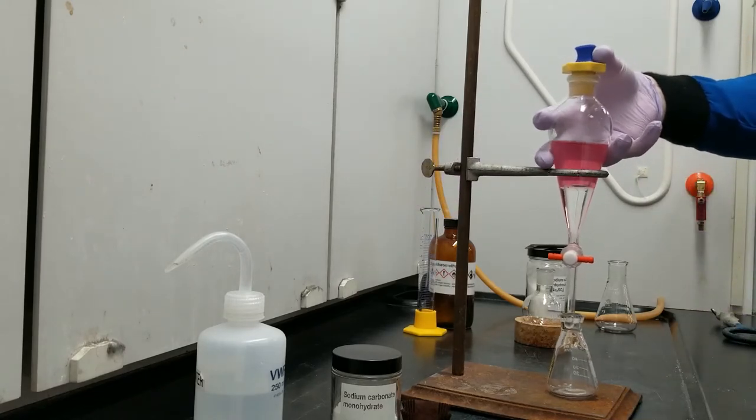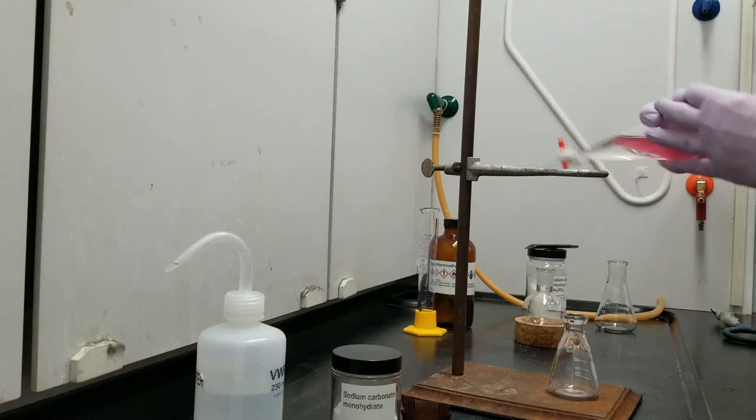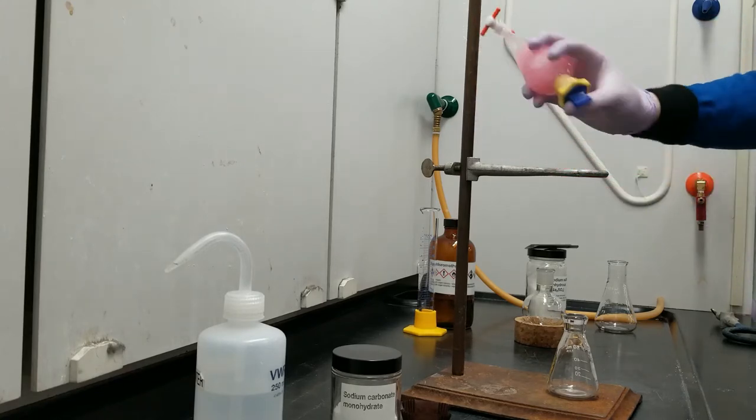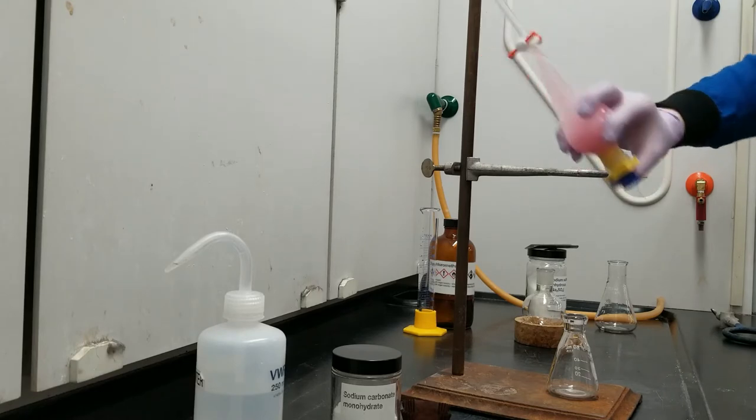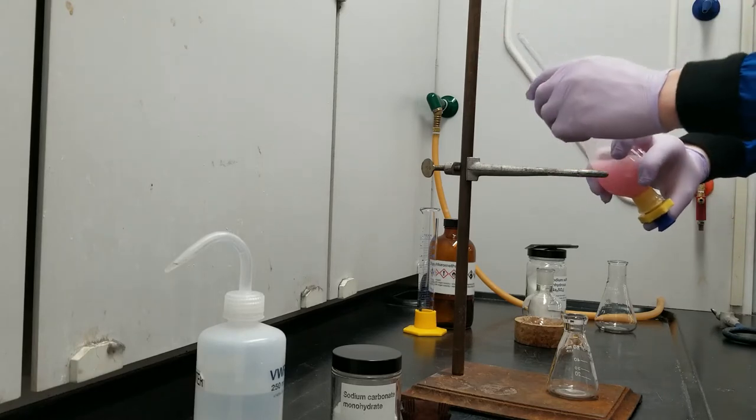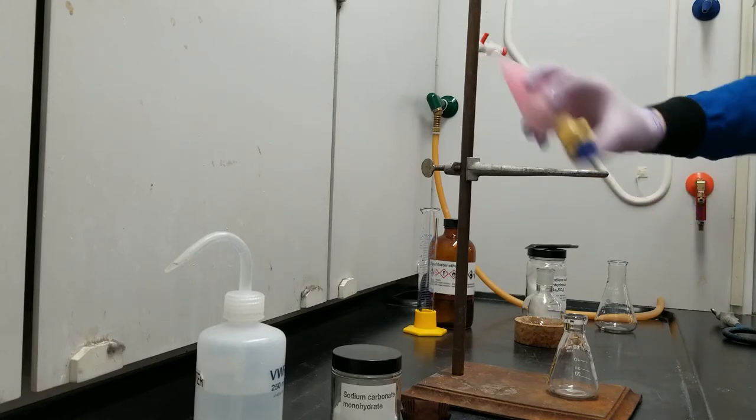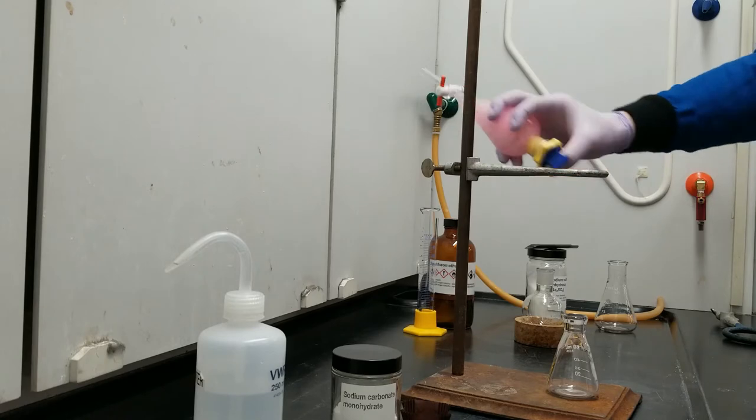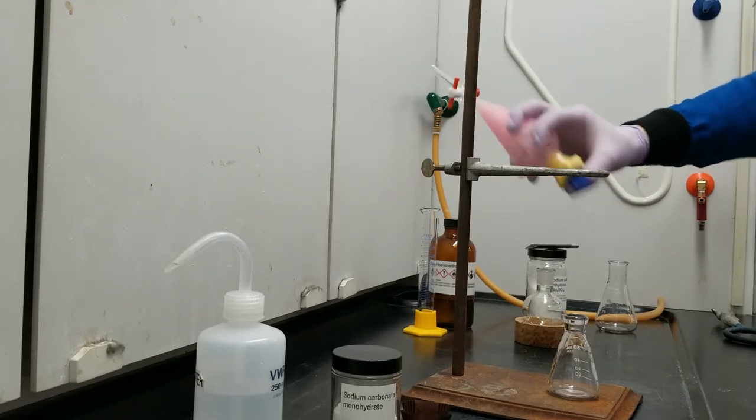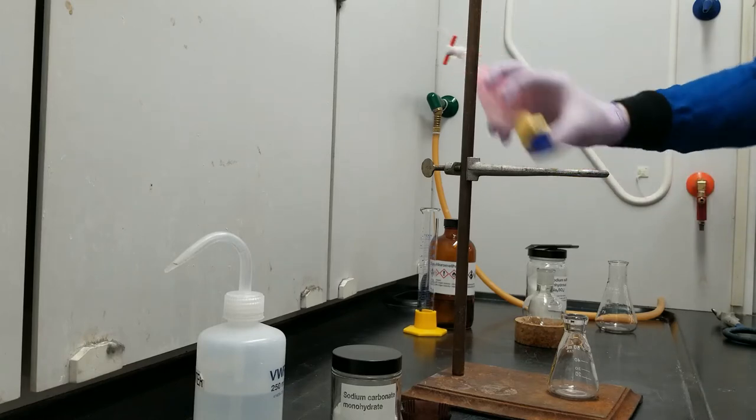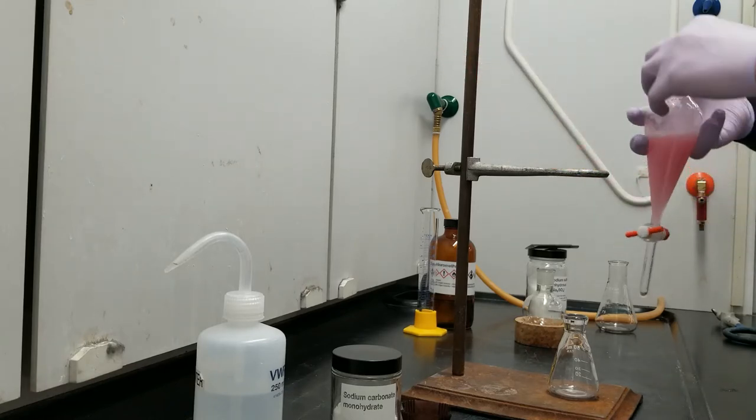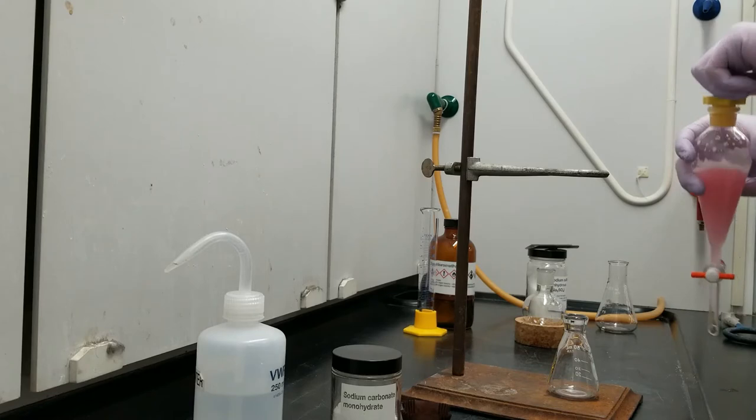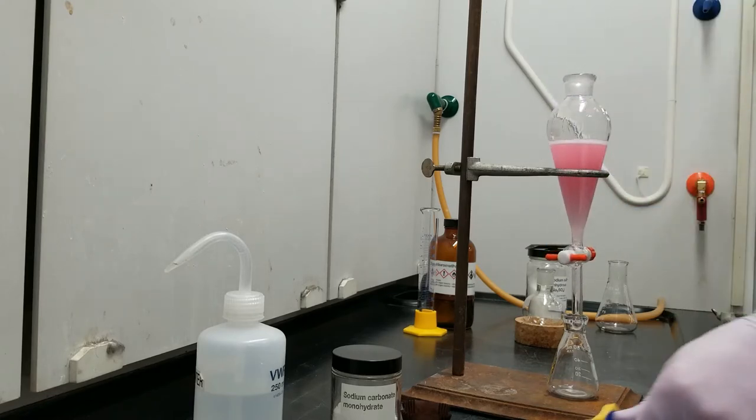So I've got my cap on and I'm going to shake several times while supporting the bottom here and I'm going to vent. Not sure if you can hear it over the fan, but you can actually hear a little whistle out of the sep funnel when I vent. It's the escape of gases that build up as you're shaking that volatile DCM around. And I'm going to do this just a few more times.